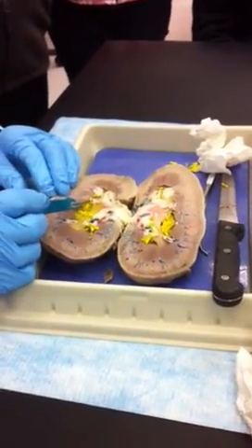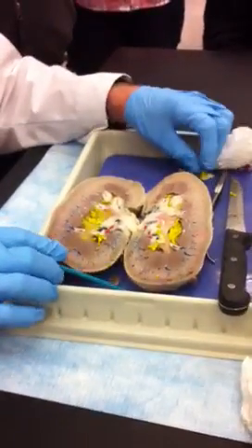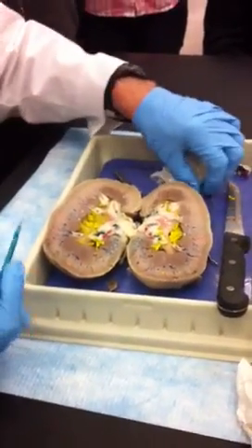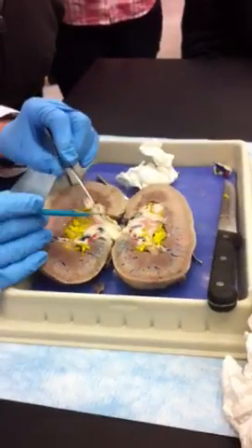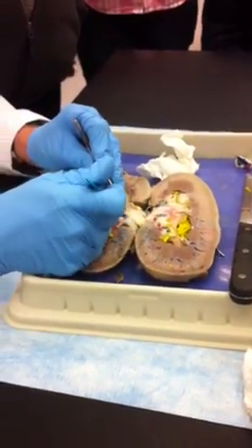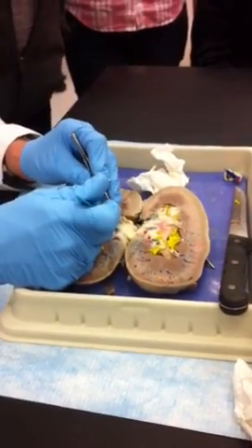This pyramid right here — we can take some of the latex out of the collecting channels here. I'm going to use my forceps to work on this. I'm going to be working down into the pelvic area right here. This is the pelvis I'm in right now.